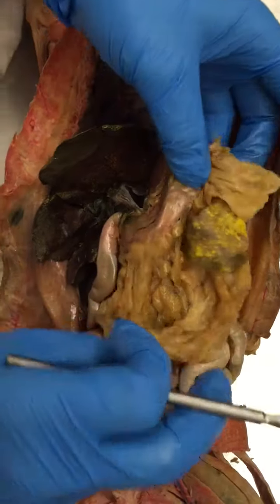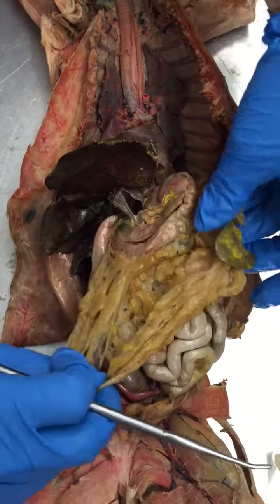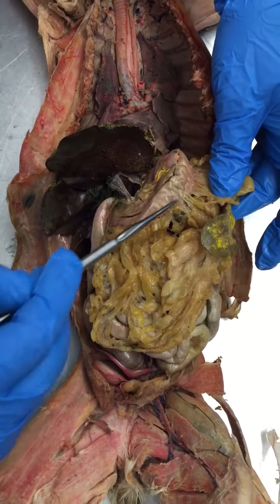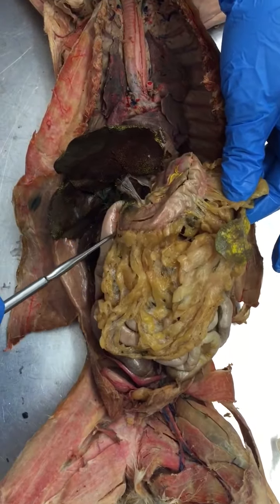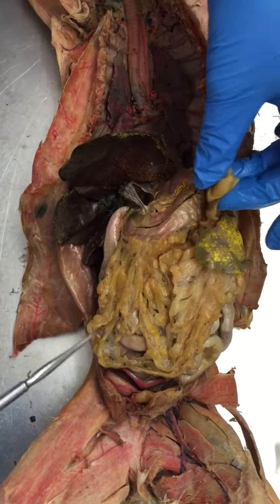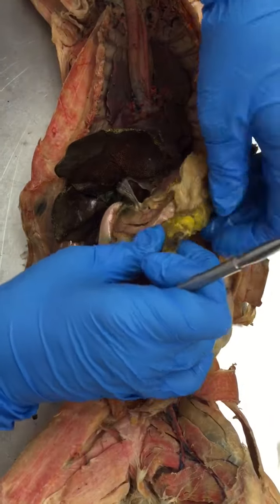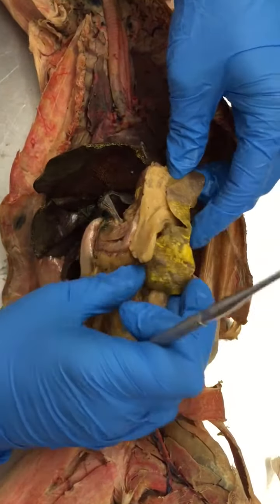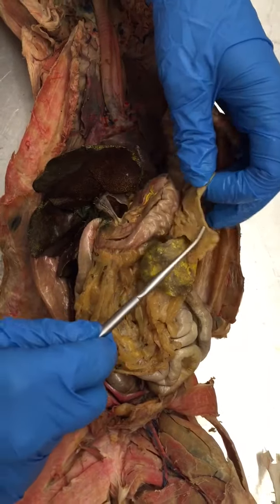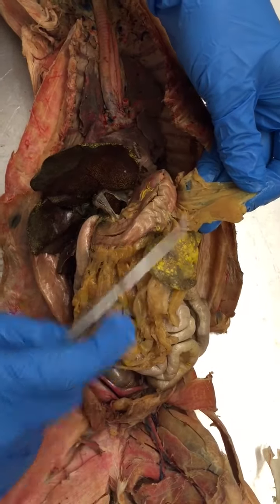The greater omentum is this large apron-shaped fat body that attaches to the greater curvature of the stomach. All of this adipose is what you would call visceral fat, called the greater omentum. And then here's the spleen, and between the stomach and the spleen, you have a thickening of adipose tissue known as the gastrosplenic ligament.